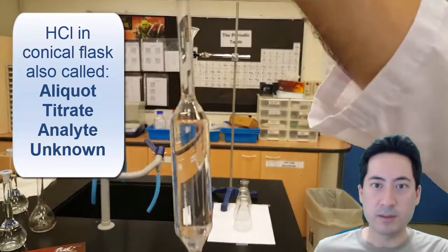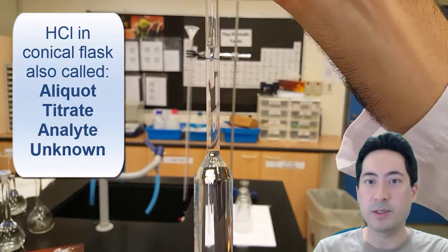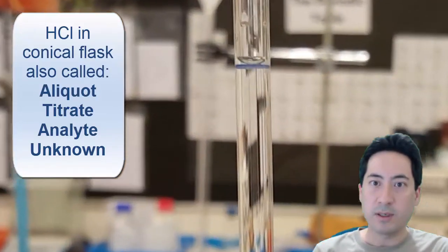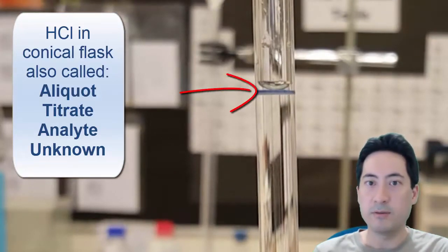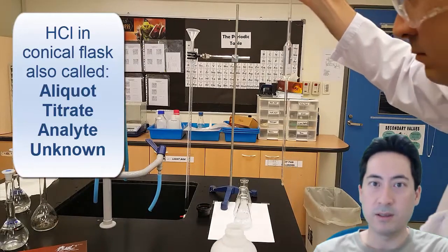So I use the bulb to help suck up the liquid and during the whole time I make sure that the pipette and the burettes are always vertical. So I'm trying to make sure that I can get exactly on the line. So I'm pulling it up to eye height and you just slowly release the bulb to make sure that the bottom of the meniscus just touches the line.